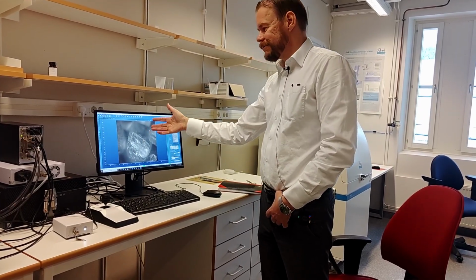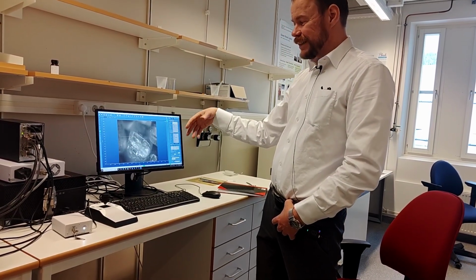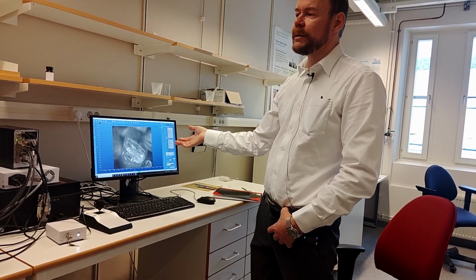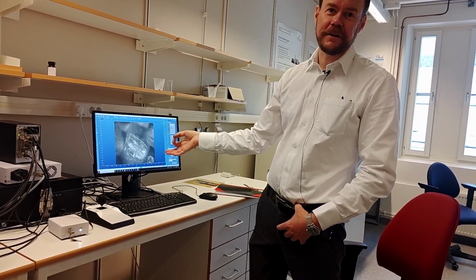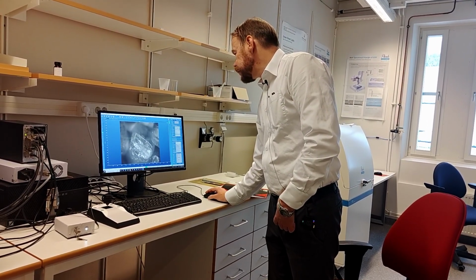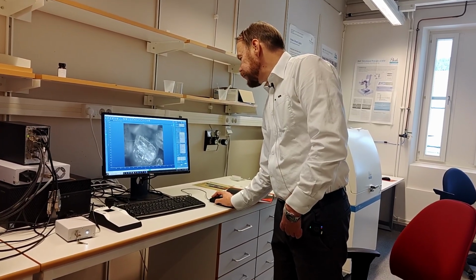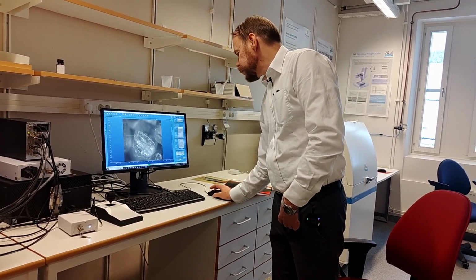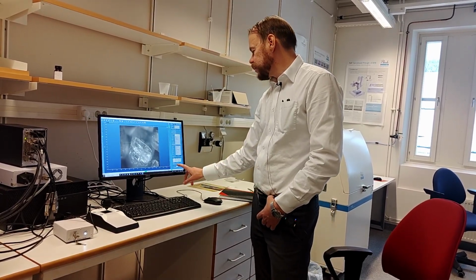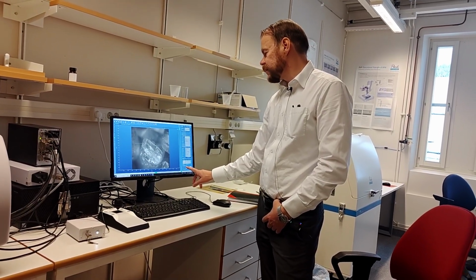But we had a somewhat good signal. I mean, 450 counts. That's a very low count number, but that was half a second. For the demonstration, we can run it for like 1 second. Then we get almost 1,000. So let's say the acquisition time is 1 second. And we don't need to do 400 points. Let's say we just want to do 20 points. Then we can see total data points is 60, and then it will take 3 minutes to do that.